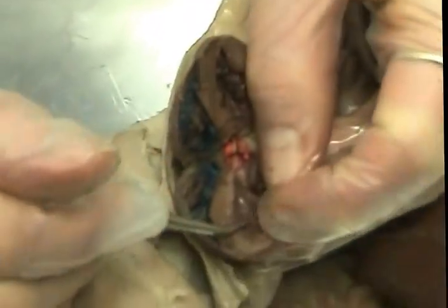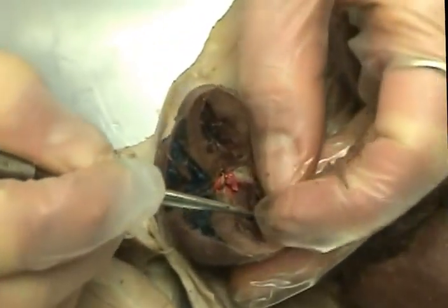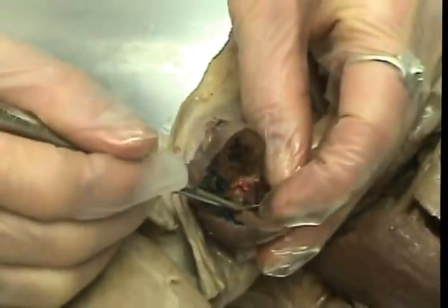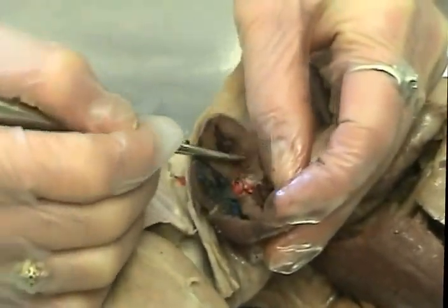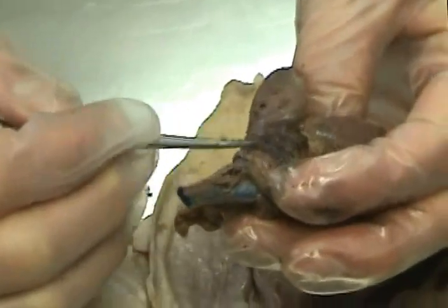Within the ventricle are these folds called trabeculae carneae to expand to fill the ventricle with blood. And these bulbs are called papillary muscle, and they contract to pull these strings, the chordae tendineae, to shut the valves. In the atria, inside, are these ridges called musculi pectinati.